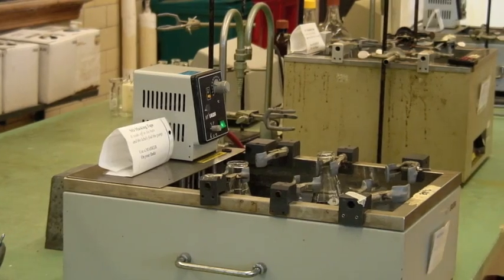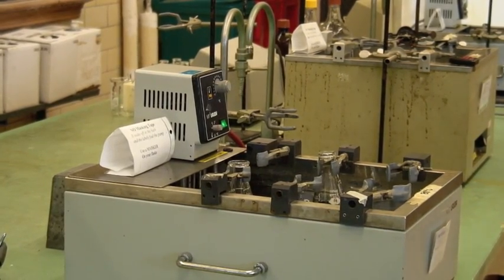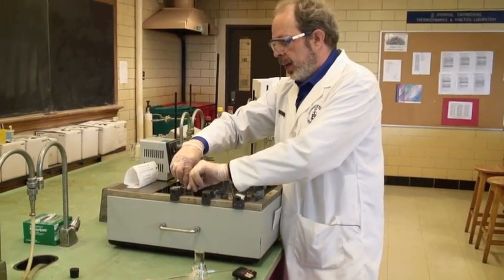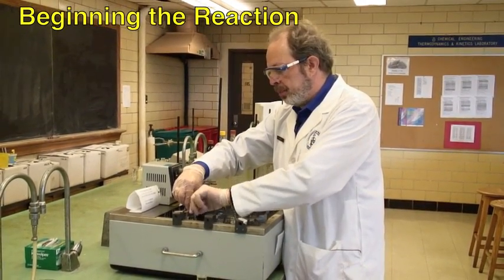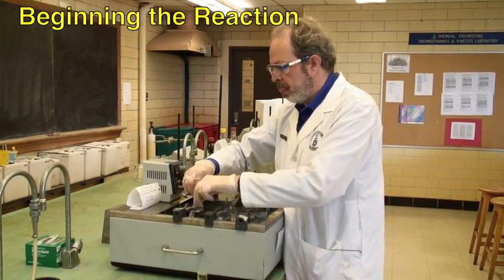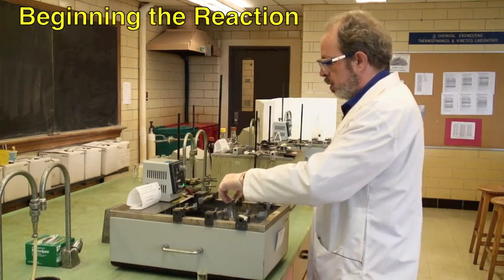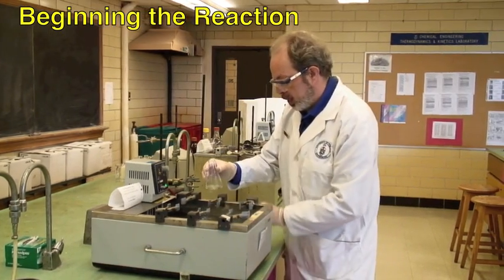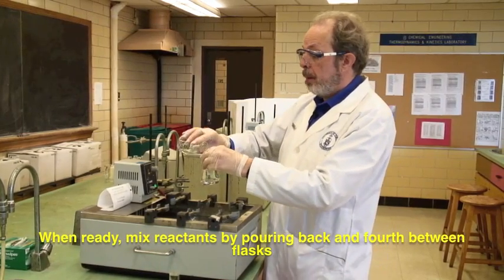I'll also need my 2 mL pipette and a bulb. Now, once I've got this ready, I open the clamps, take my 2 mixtures, and when I'm ready to go, mix the 2.